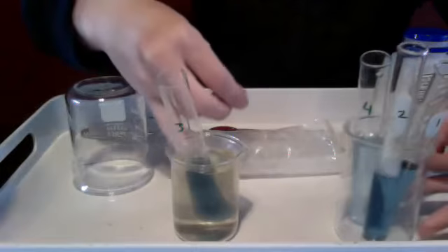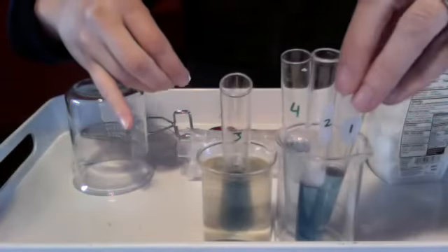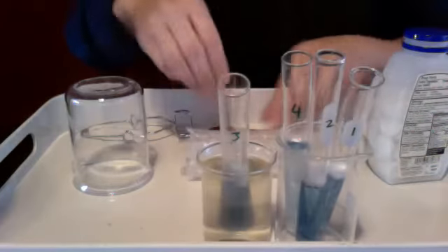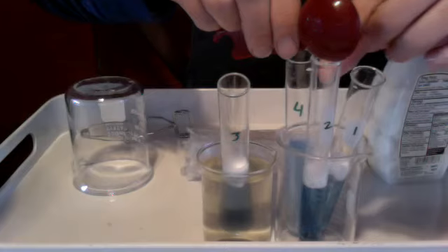I'm going to try to drop them in at about the same speed, but not perfect. There's only one of me. Generally, you would all do this for yourselves. So let's see, here we go. Get them all on the screen. Here's number 1. Here we go. 1, 4, 3. Coming for number 2 with my ground up amount.